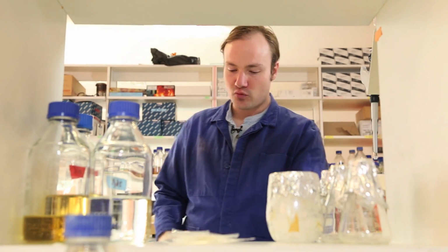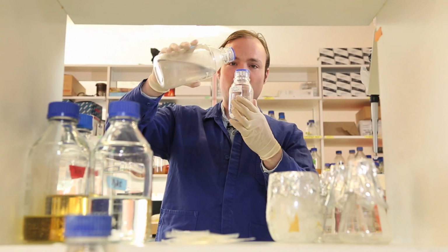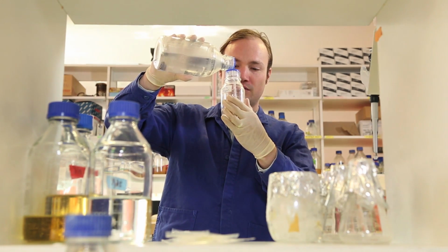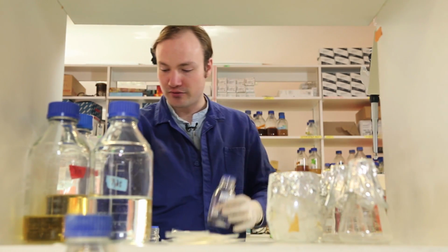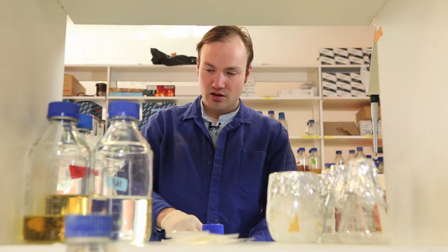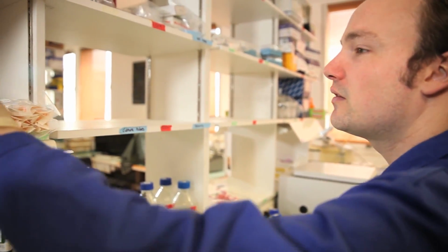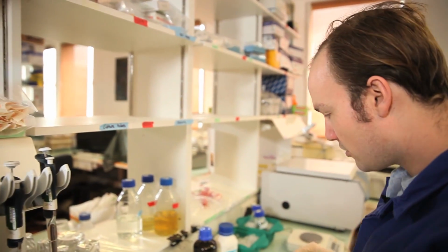I'm also going to add some water to the calcium chloride solution, but I'm not going to add the full 100 milliliters yet. I'm just going to take it up to 50 mils so that there's room left over for adding the glycerol. Okay, so now let's pipette the glycerol. I need 15 mils of glycerol.